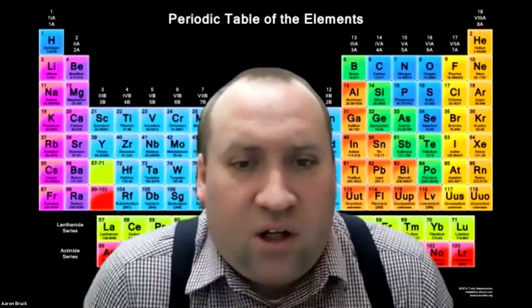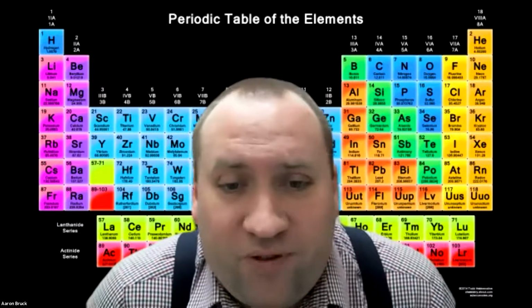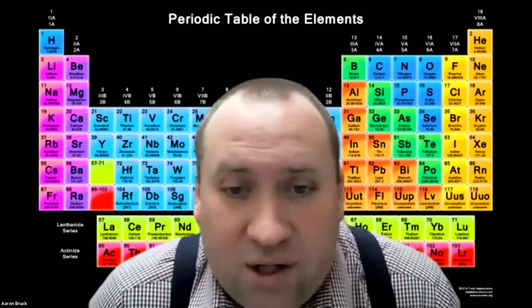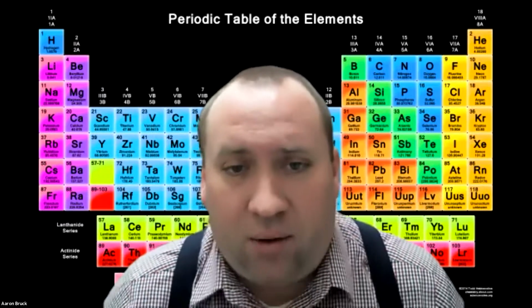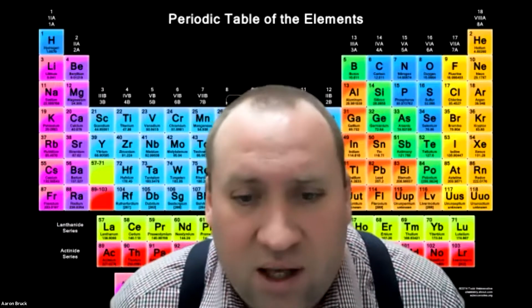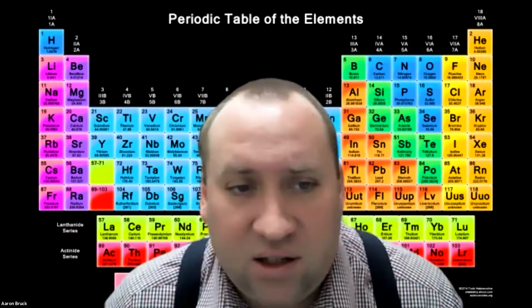All right, in this video, we will be going through the procedures for the virtual lab V10, that is acids and pH and acid dilution. This is your virtual lab for week 9 here in Chem 106. So let's get into what that actually looks like.